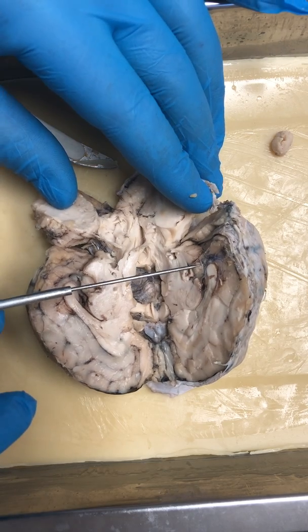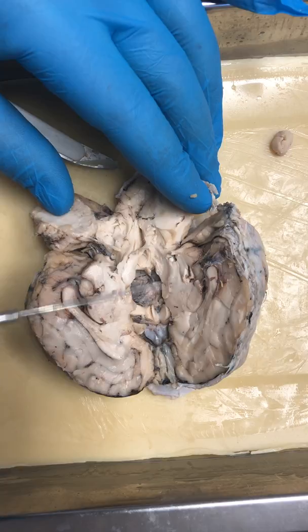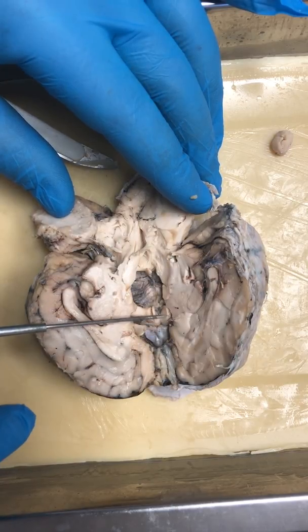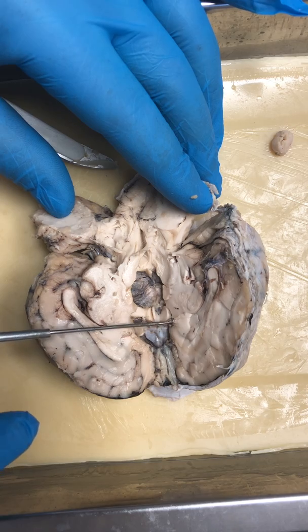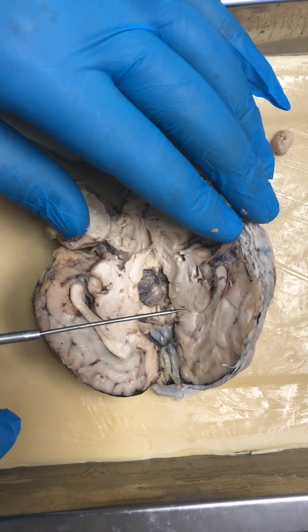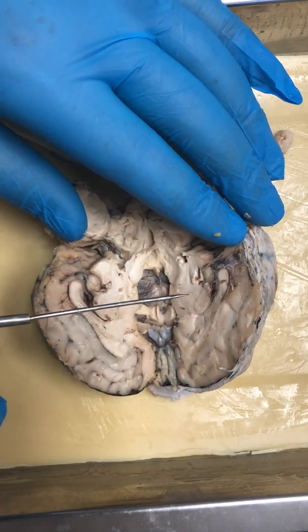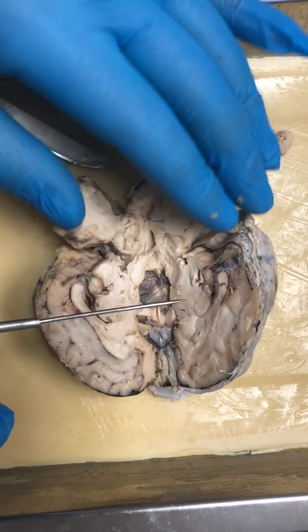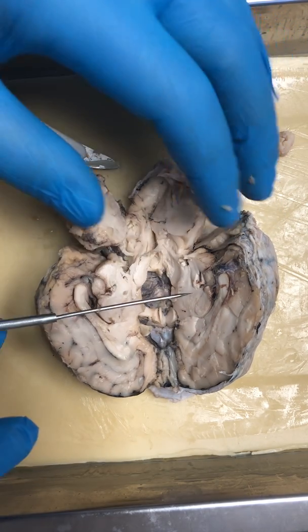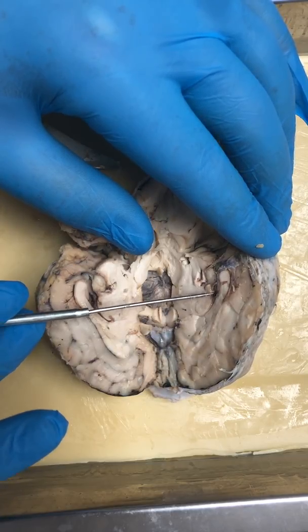Then you have your 3rd ventricle up here. And your lateral ventricle right here. Can you get a good view of that? And in each of those, I don't know how to quite say this correctly, is the choroid plexus. And the choroid plexus is in the 3rd ventricle, if you can see in there.